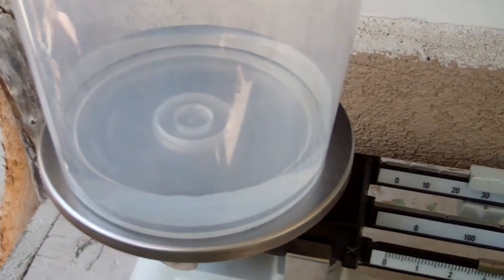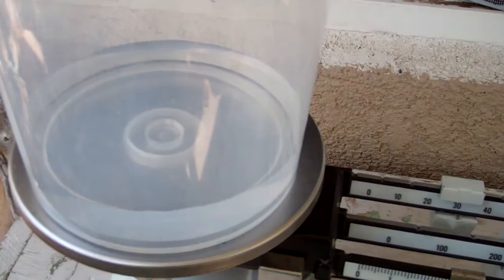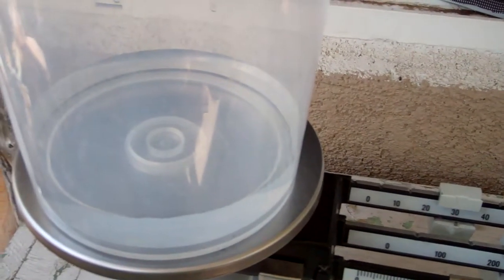Now look at what I put on the pan. Is that the mass of the water? I don't think so.